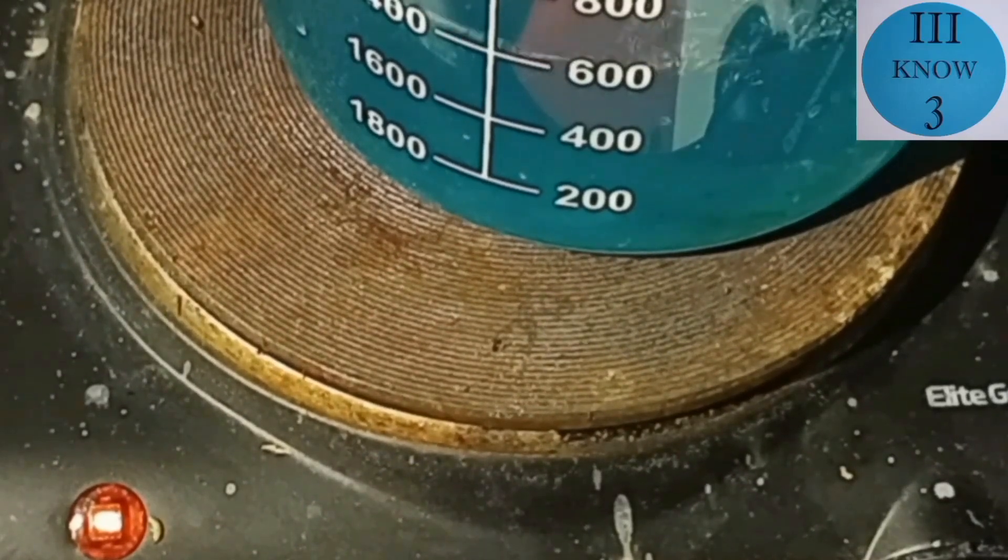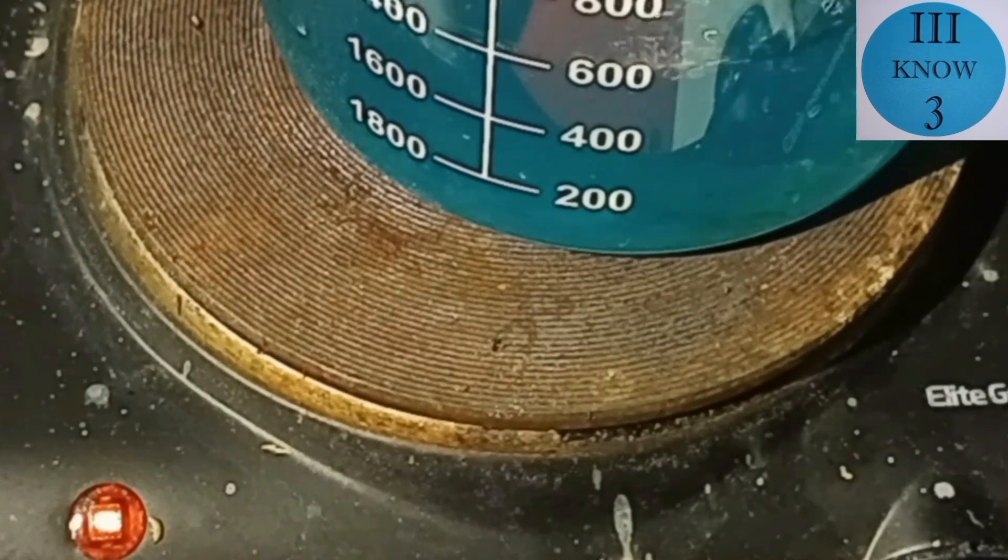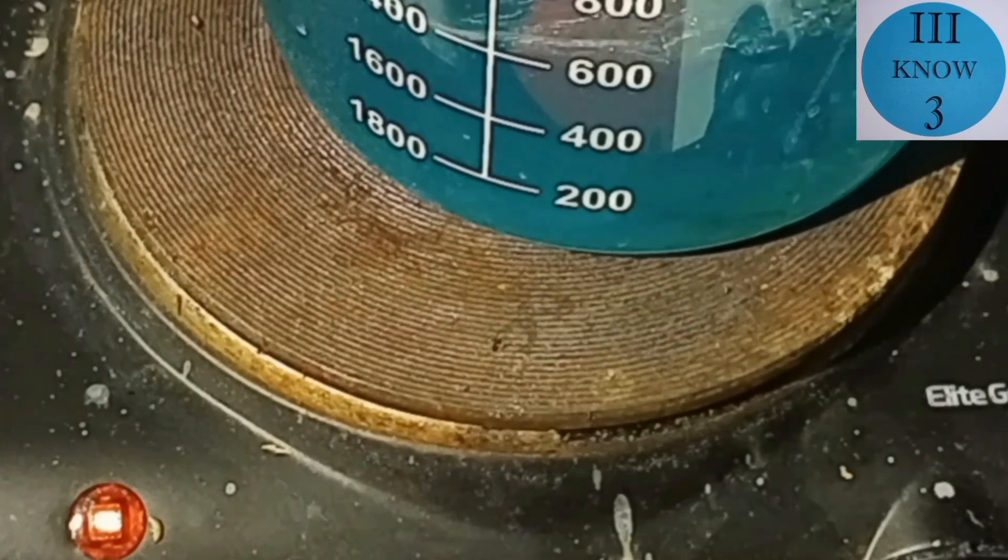This is a solution of copper and nickel and we're going to try to get the nickel and the copper out of the solution and separate them.